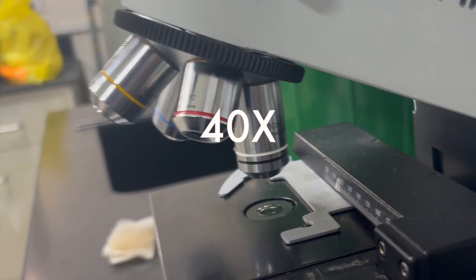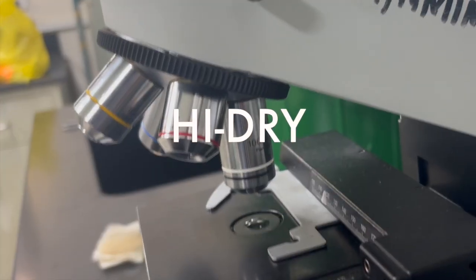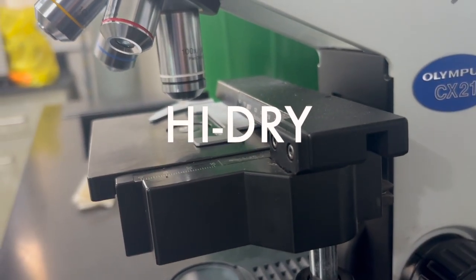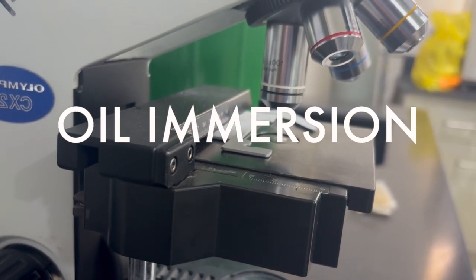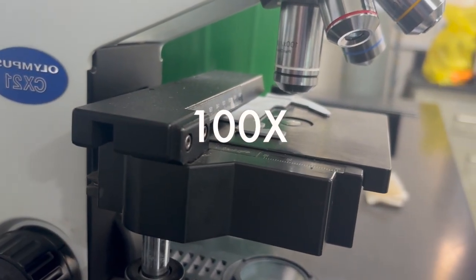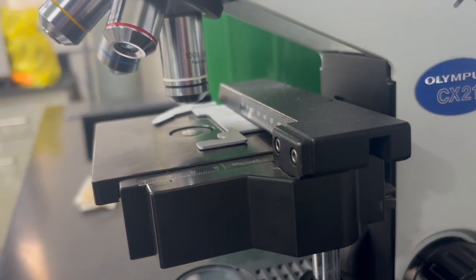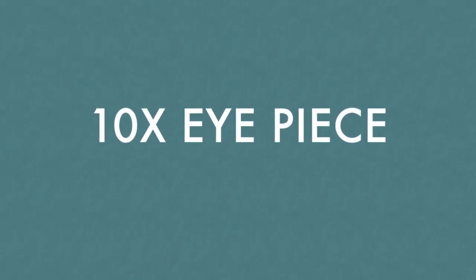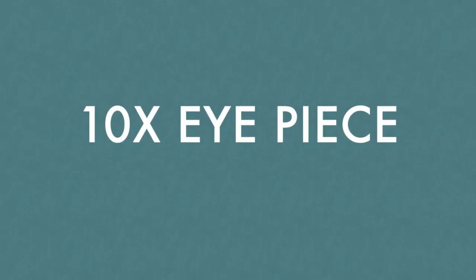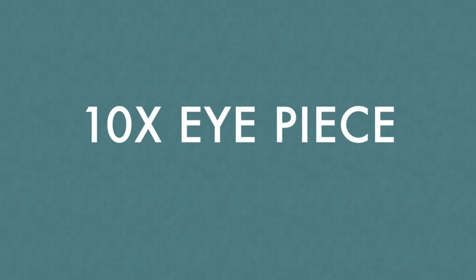And then there's also a 40x objective, and this one is called a high dry, because you can look at your specimen at this objective without any aids. And then there's an oil immersion objective, and this one is generally 100x. So once you've looked at the objectives, what you've picked to look at your specimen, you always multiply by 10 because of the eye or ocular pieces that by default amplify 10x. So if we used a 40x objective, then we will multiply by 10, and we will know that that image has been magnified 400 times.